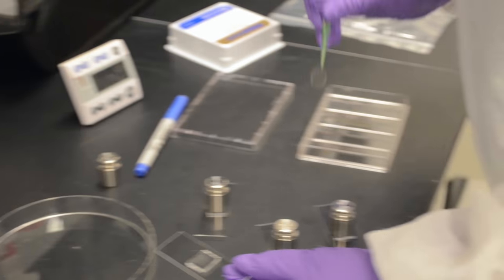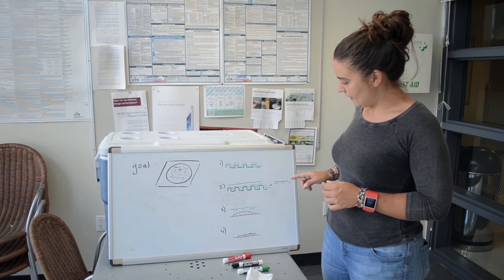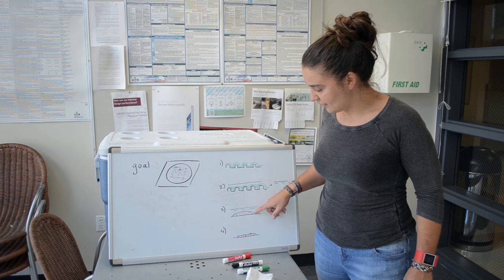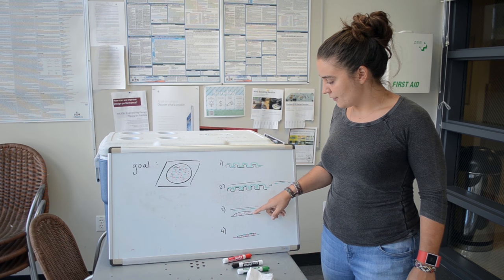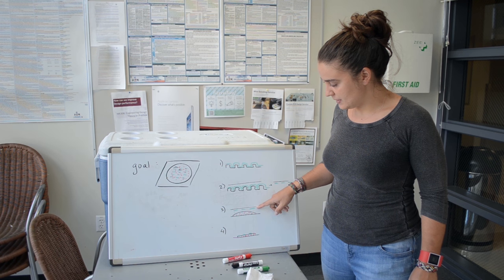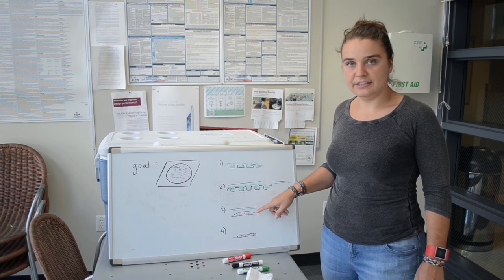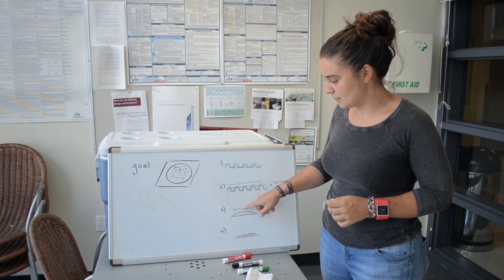And just lift it off, put it in there. And then after we have this piece of glass of protein, we're actually going to take the gel and mix up all the ingredients of the hydrogel and then put the protein covered glass on top. And as the gel is solidifying, it will actually take up these protein islands.